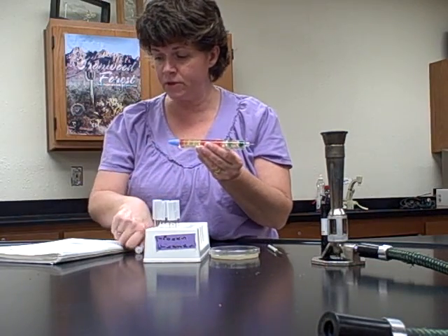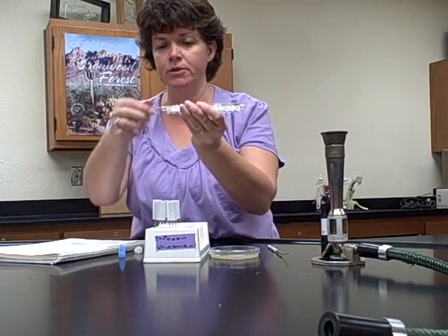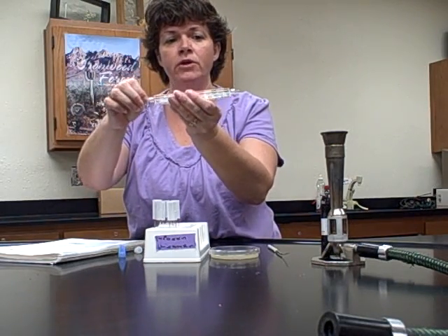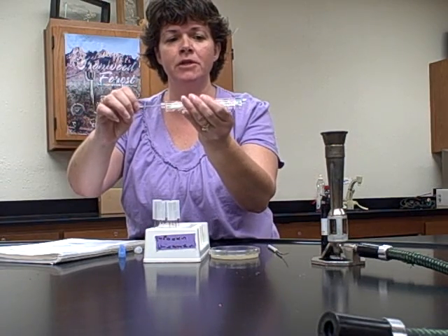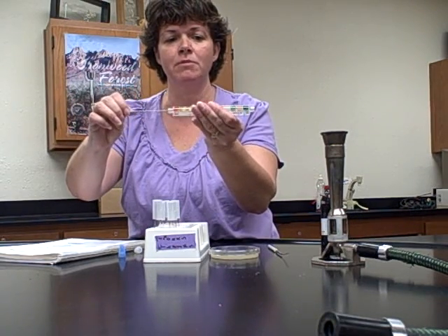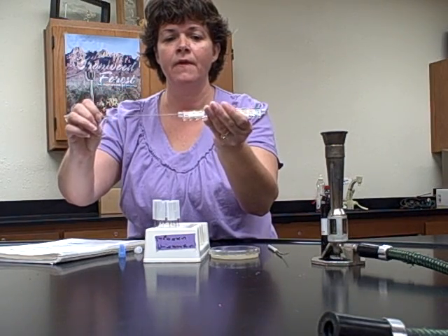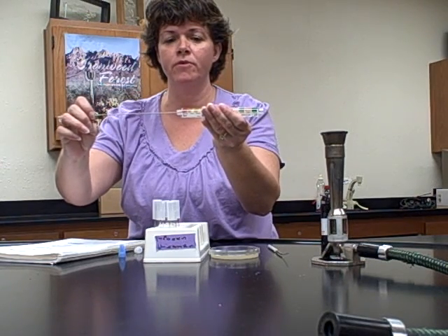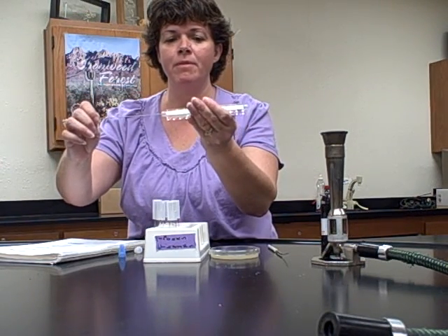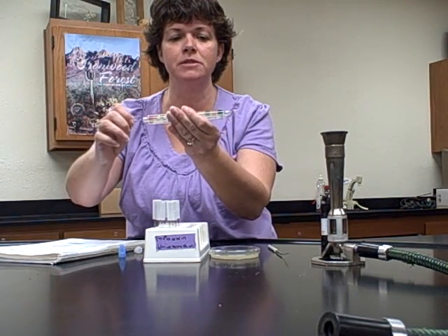And then it says hold the bent end of the wire, so the other end that came off the blue is this one here. And what you're going to do is pull it through, and see how I'm kind of twisting it as I pull it through, because I want to make sure that I get inoculum on all sides, okay? And then it says to put it back through. So you pull it through all the way, and then you send it all the way back. Okay, once again, we're just trying to get as much inoculum on everything as possible.